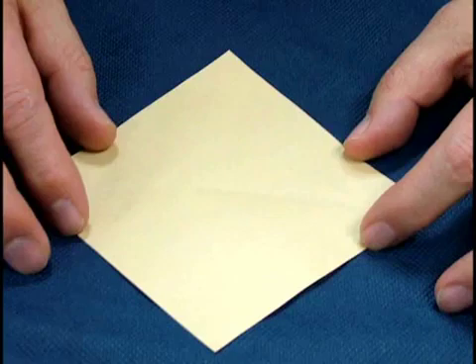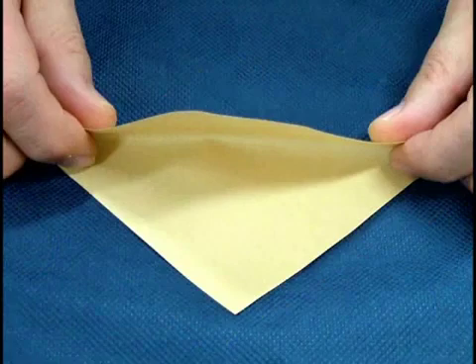The crystalline sample can be packed in weighing paper and stored. Firstly, fold the weighing paper to form a triangle.